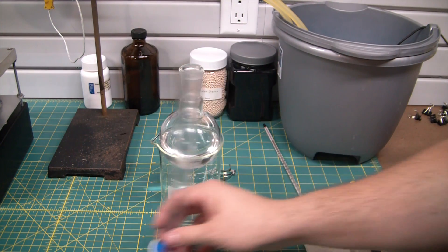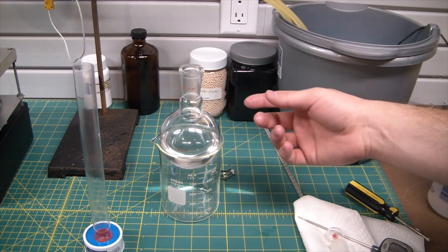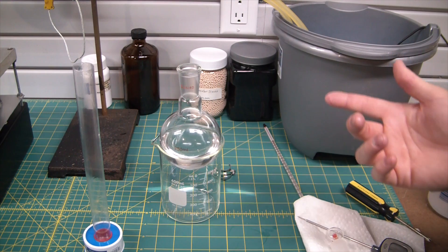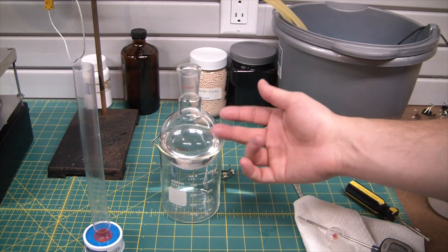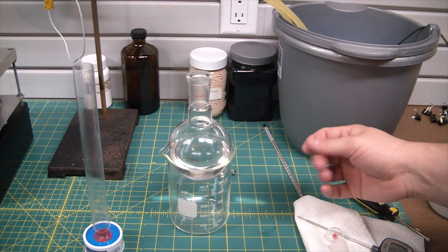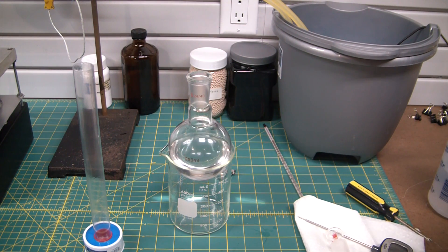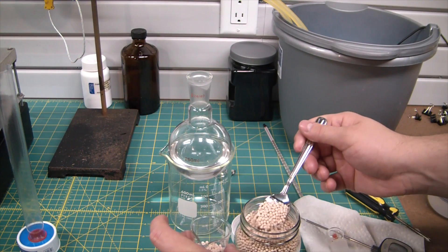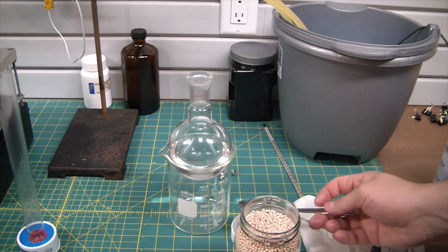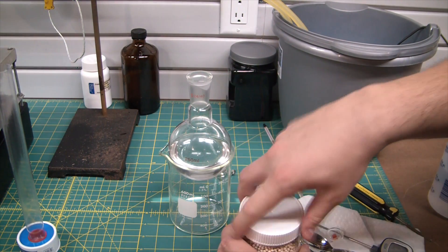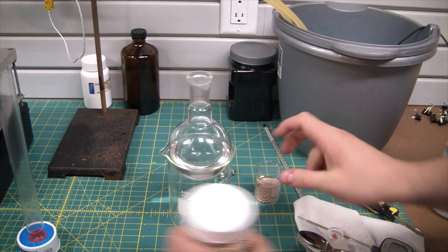So we're up from 76 percent to 96, so that's still a good jump from the copper sulfate. Not bad. I was hoping this would be totally anhydrous at this point. I'm really surprised some water came over, but I guess at this point we got to use the molecular sieves. Probably should have reactivated these for a few hours before using them. They've been sitting in this jar for a couple years.